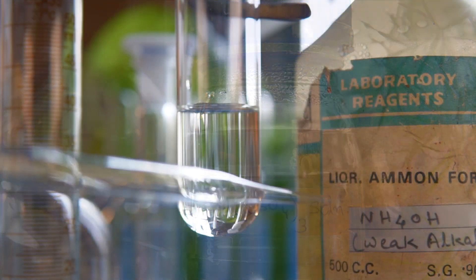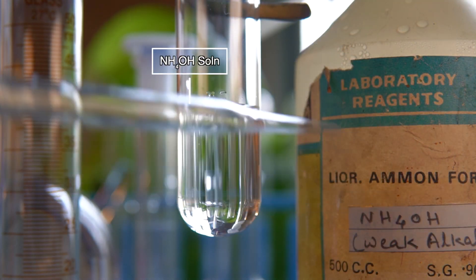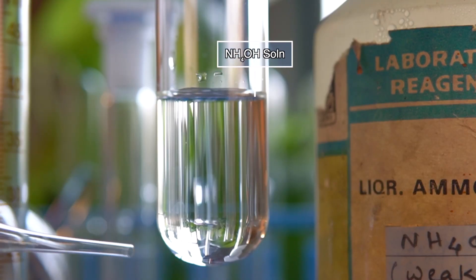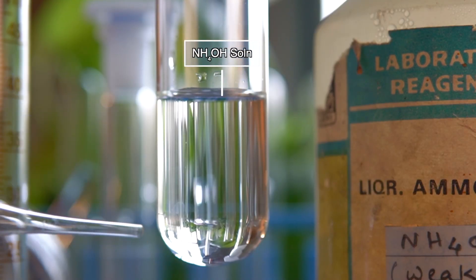Now to initiate the chemical reaction we will take some amount of ammonium hydroxide into this test tube.